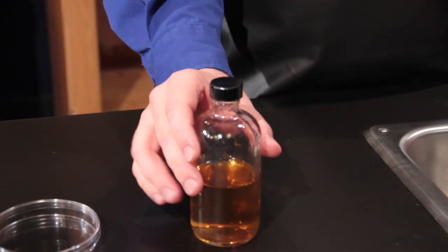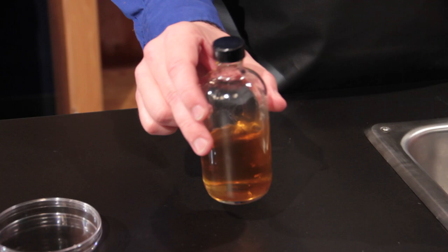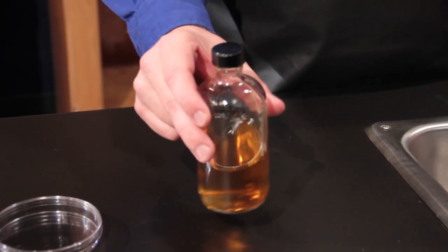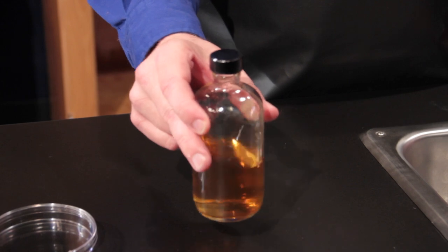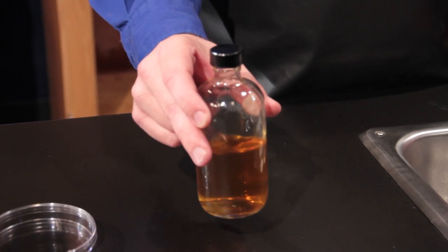The bottle has cooled until I can now comfortably hold it without my glove. This is about 45 degrees Celsius. Don't worry about it solidifying. Agar has to cool way below its melting point before it gels.